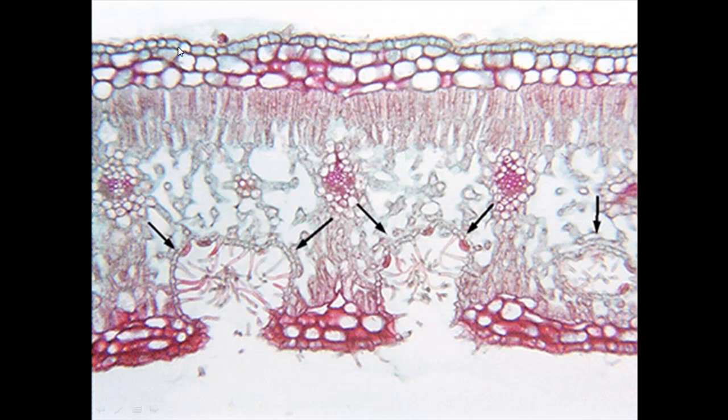So here we've got the epidermis. I'm sure you could all pick that out. On the lower surface we've got a bit of an epidermis too. On this last little bit here it's not so clear, but I would assume it's still there. It's along the top. We're going to assume there isn't just a random patch where it's missing epidermis. Underneath, this is probably collenchyma, this layer here. Palisade mesophyll, spongy mesophyll, where there's all these air spaces.